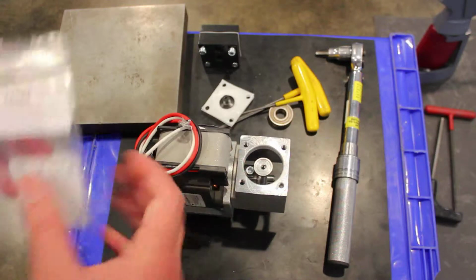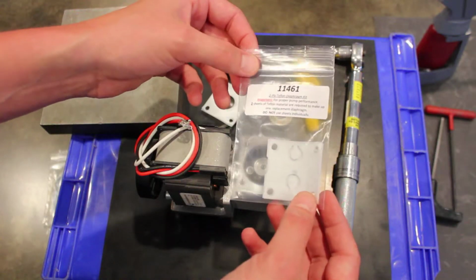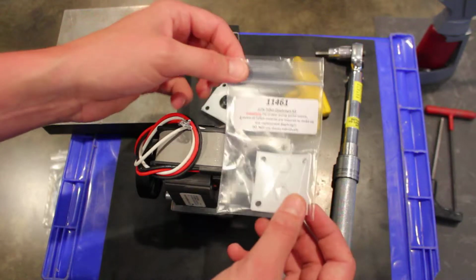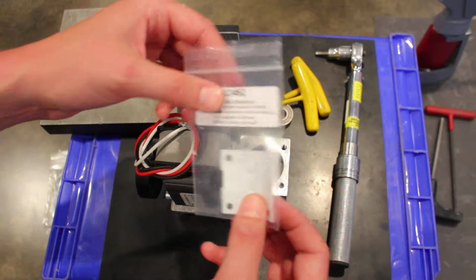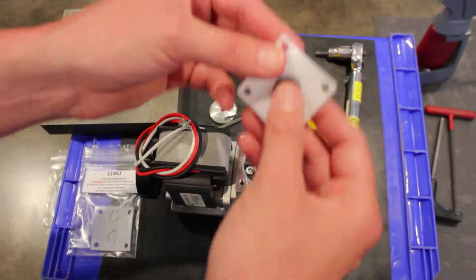We want to grab our kit. Now this is kit number 11461. It's an all Teflon micro repair kit. And this is the most common repair kit, but depending on your model number, you may require a slightly different one with different materials. But in any case, we'll go ahead and start with the diaphragm assembly.